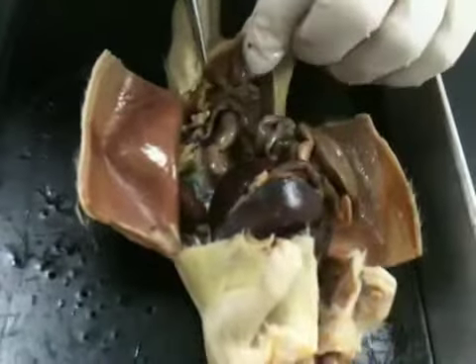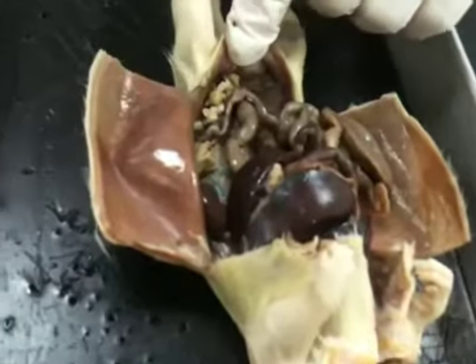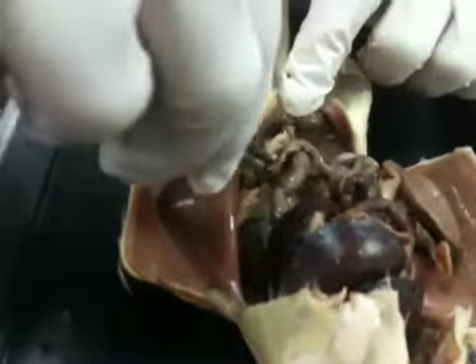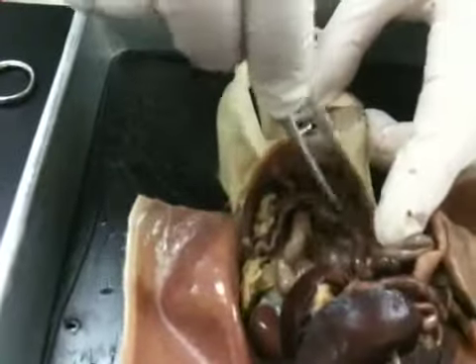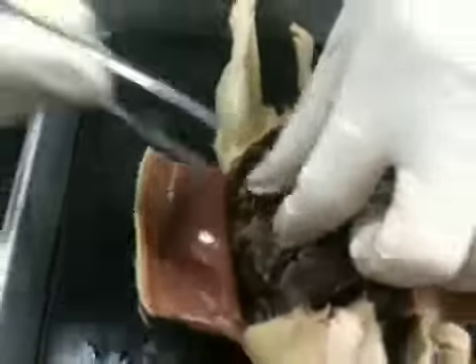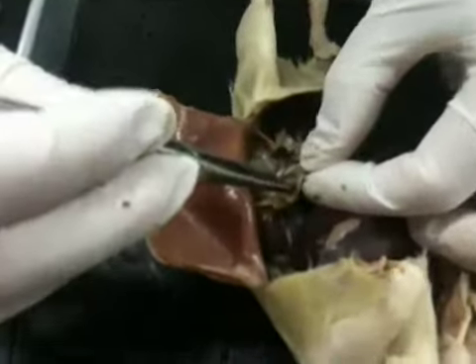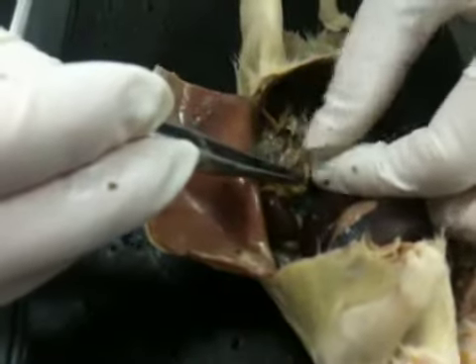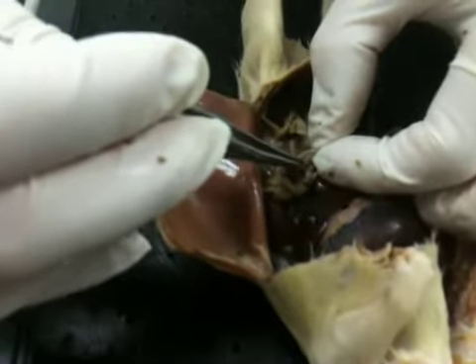and you can see her uterine horns. So her uterine horn, there's a uterine horn right there, and there's the other one. So very, very small in comparison. And if we locate her ovary, there's her ovary that is actually somewhat enlarged. And then her fallopian tube or oviduct is right there.